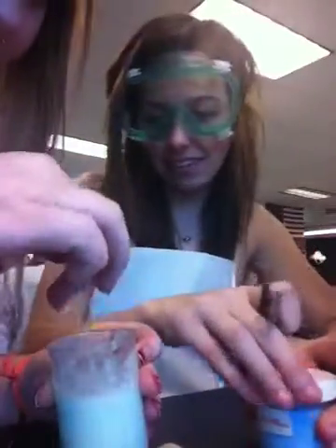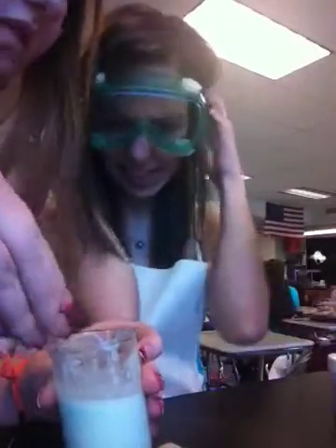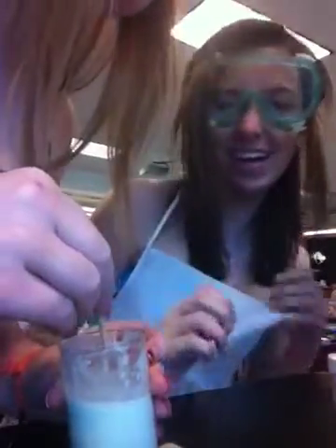Okay, let's go. Just put one more thing in there. One more of this? Because this is getting liquidy, so that's good. Maybe like two stuck together. Yeah, there we go. Oh, that one. I don't like this.